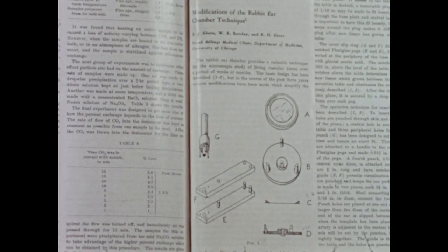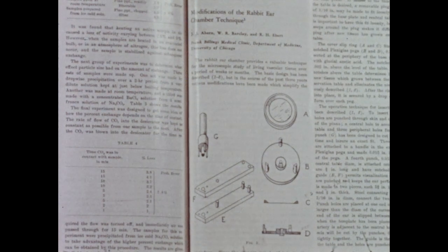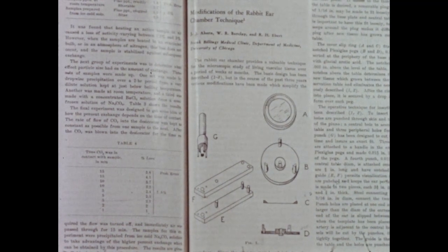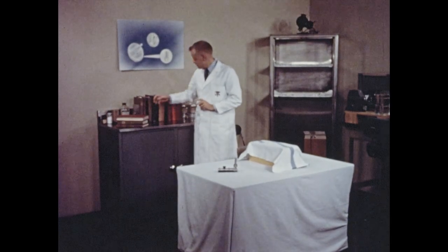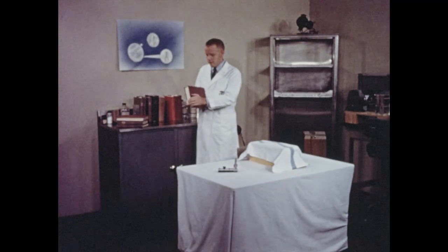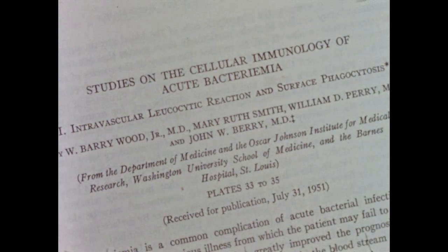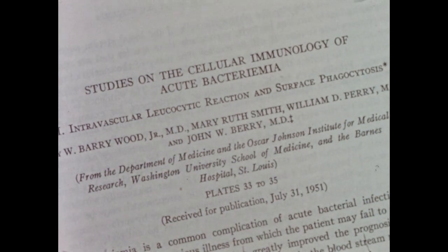In 1949, Ebert and associates employed the chamber and developed a special punch and template and a simplified version of the ear chamber itself. This later simplification was used by Wood and associates in their studies in 1951 on the cellular immunity of acute bacteremia, including their description of intravascular leukocytic reaction and surface phagocytosis.